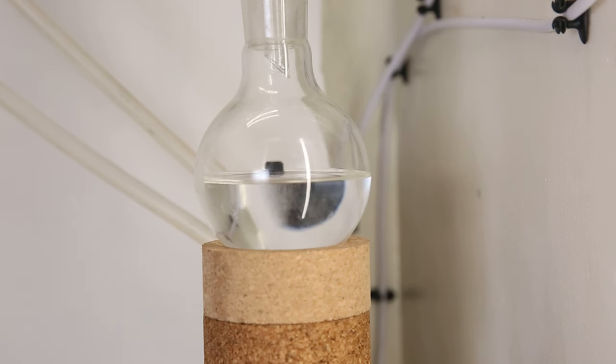Also, if there is any MTBE in this fuel, it should also be in this fraction. Since ethanol and MTBE are both soluble in water, I will simply wash this fraction with water afterwards, which should take out most of the ethanol and MTBE.